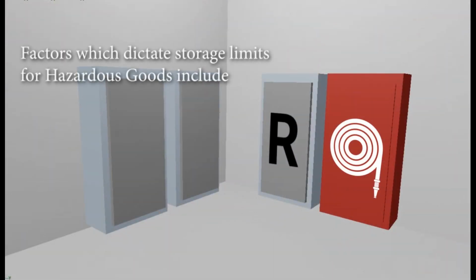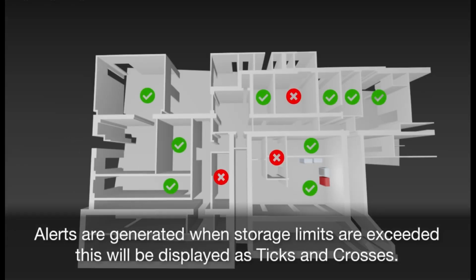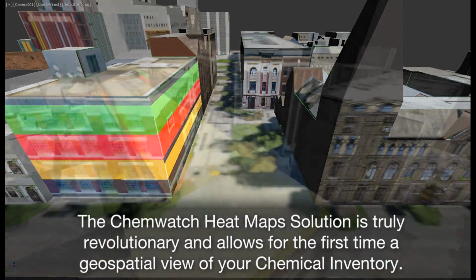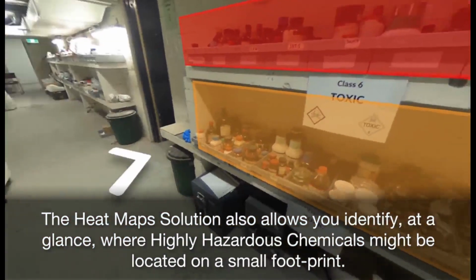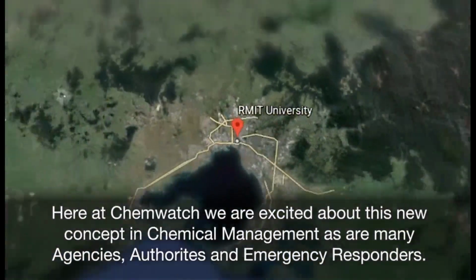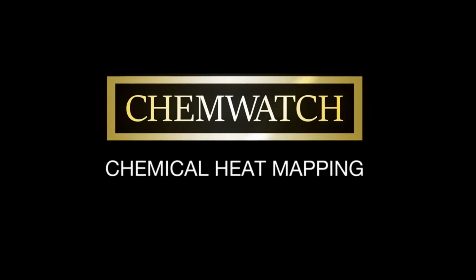Factors which dictate storage limits for hazardous goods include floor level, sprinkler systems, access to firefighting equipment, availability of regulated cabinet. Alerts are generated when storage limits are exceeded. This will be displayed as ticks and crosses. The Chemwatch heat map solution is truly revolutionary and allows for the first time a geospatial view of your chemical inventory. The heat map solution also allows you to identify at a glance where highly hazardous chemicals might be located on a small footprint. Here at Chemwatch, we are excited about this new concept in chemical management, as are many agencies, authorities, and emergency responders. Chemwatch, chemical heat mapping.